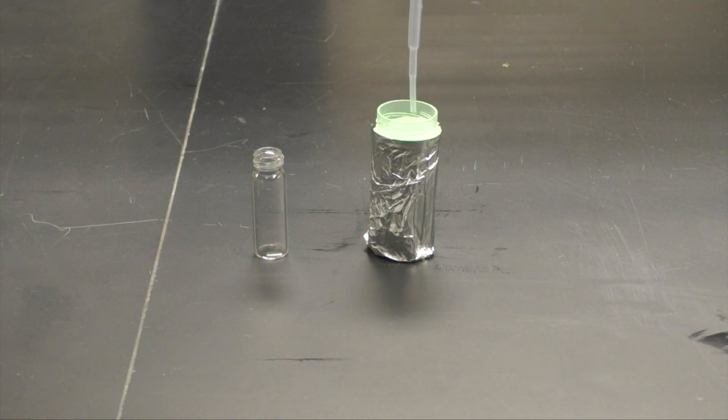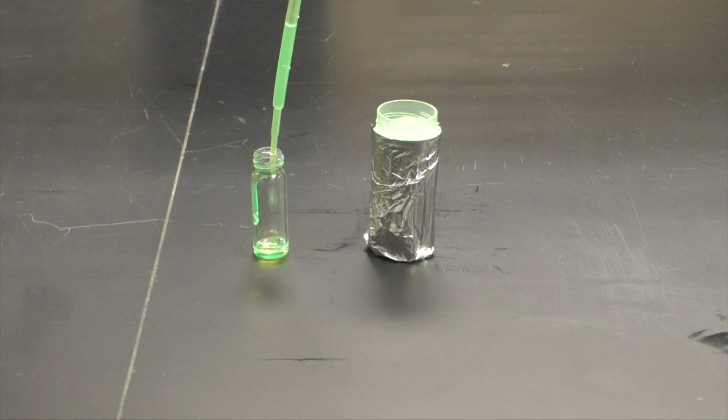The vials you are using can only hold a small amount of liquid, so you will only need to add about 1.5 milliliters of glow stick solution to your vial initially.